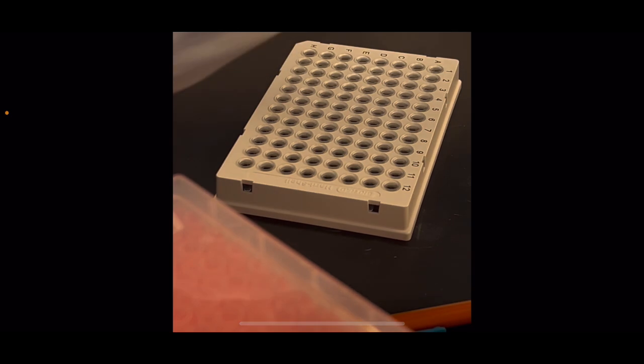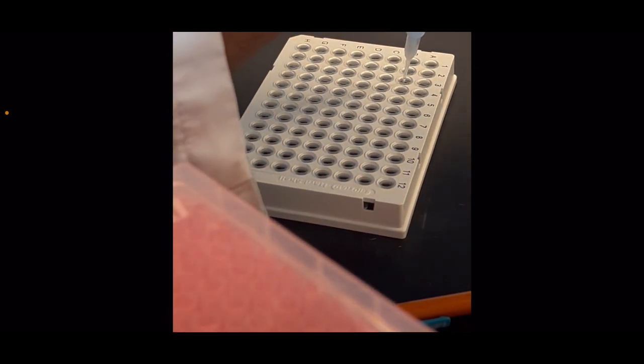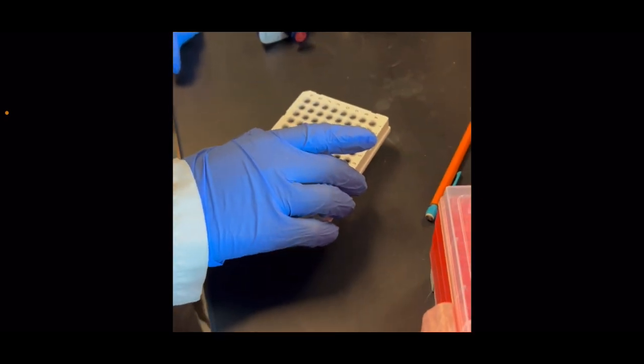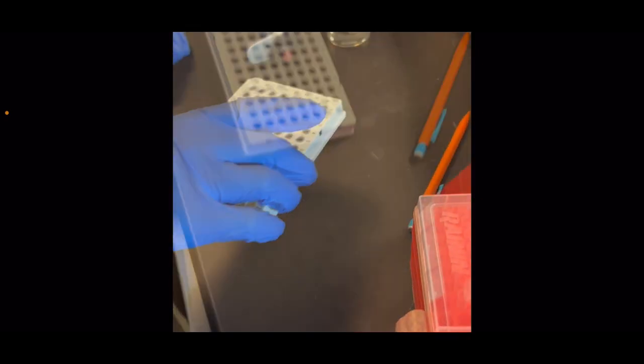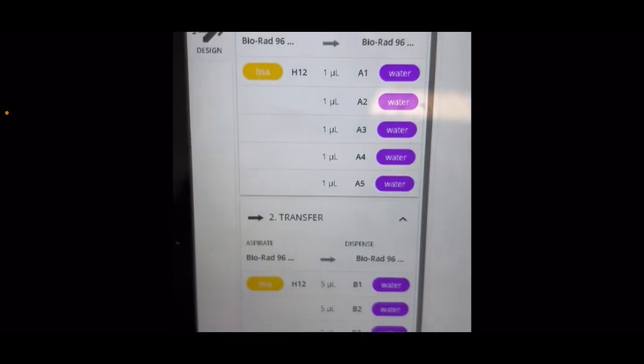As you can see, you have to pipette, preferably straight to the bottom, but as you will see later, this is the 5 microliters reading that I used for wells B1 to B6. And here, as you can see, some of it was stuck to the side because of human errors in pipetting. I'm going to be tapping it on the ground to have the liquid pool at the bottom of each well. This is the 1 microliter reading that I added.